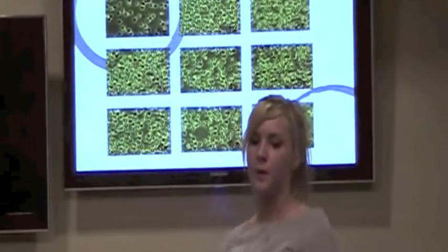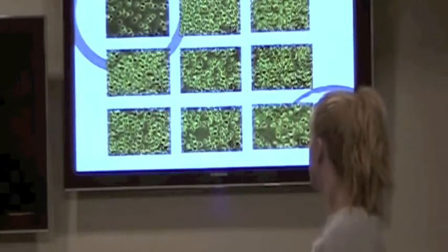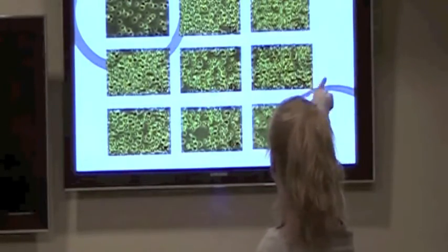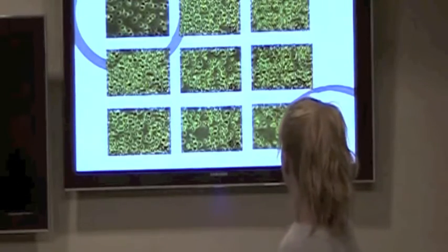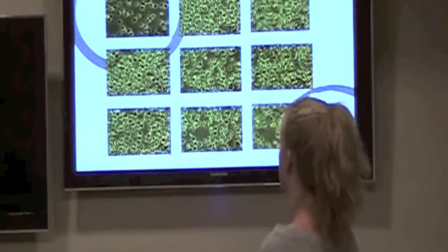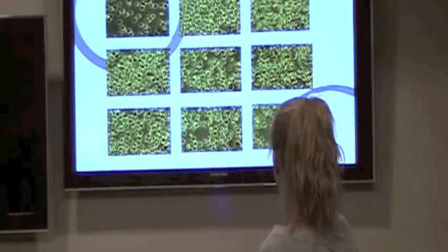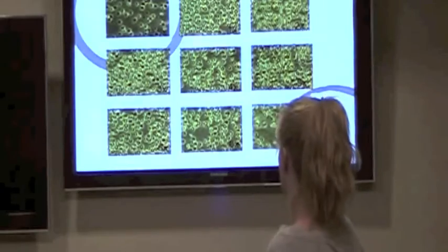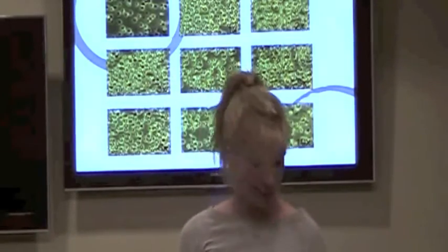This is the new buffer, the last buffer that we used, and different dilutions. It goes from left to right, and then across the rows, and then down. You can see kind of a strange pattern. We had the crenation in the 0.5x, the 2x, the 3x, but then not in the other ones. And we figured out it had something to do with the osmotic pressure.